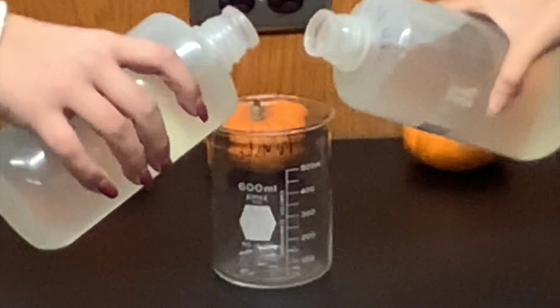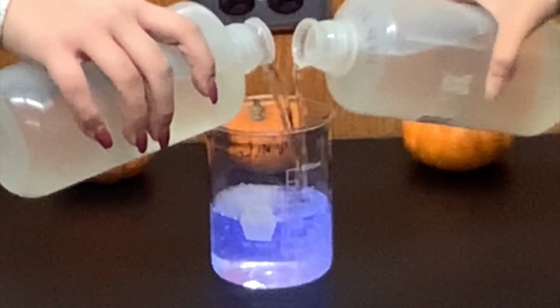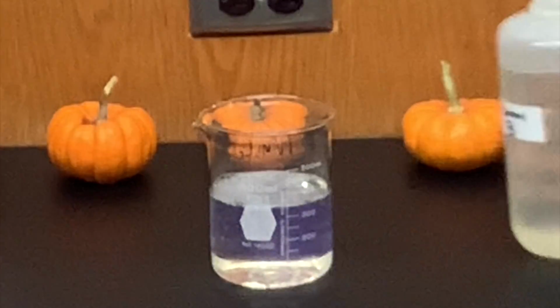In this reaction, you can see it in the nighttime sky in the summer. So take a look at this and try to figure out what reaction might be happening. We have two colorless substances again, and we're mixing them together to form a bright light.